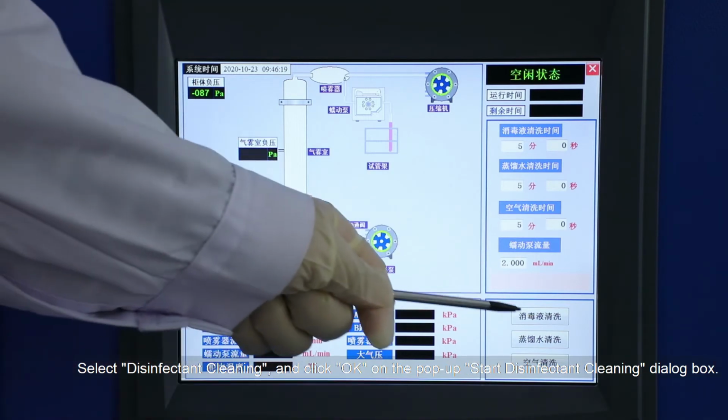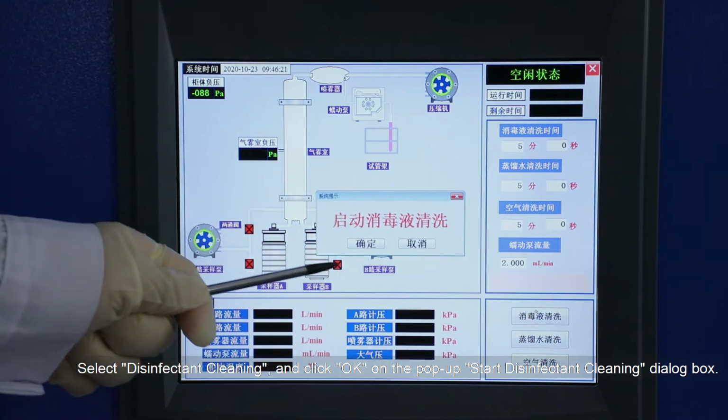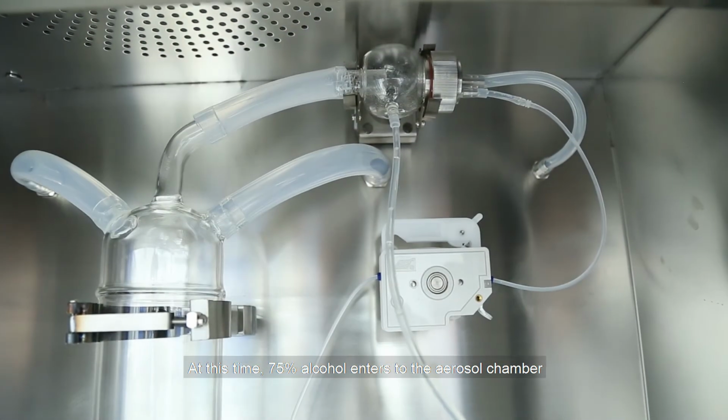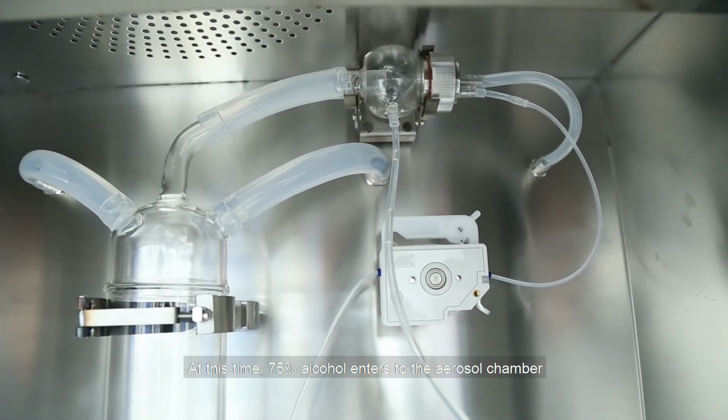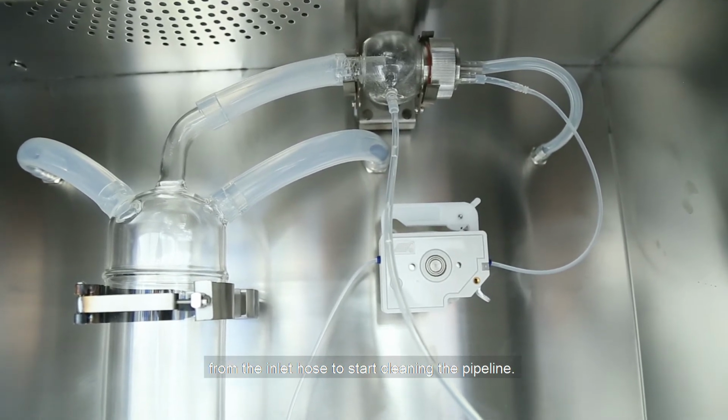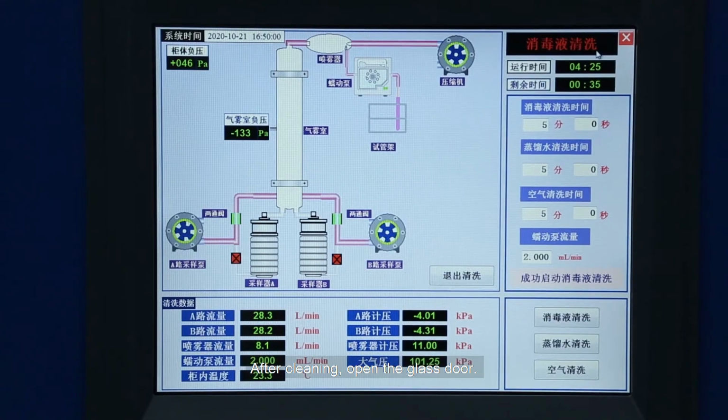Select Disinfectant Cleaning and click OK on the pop-up Start Disinfectant Cleaning dialog box. At this time, 75% alcohol enters the aerosol chamber from the inlet hose to start cleaning the pipeline. After cleaning, open the glass door.